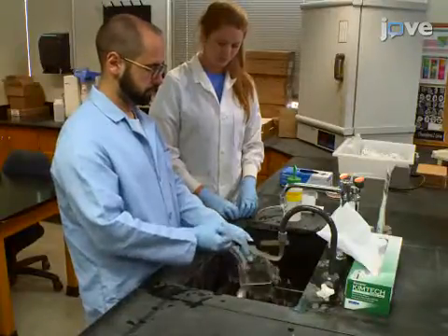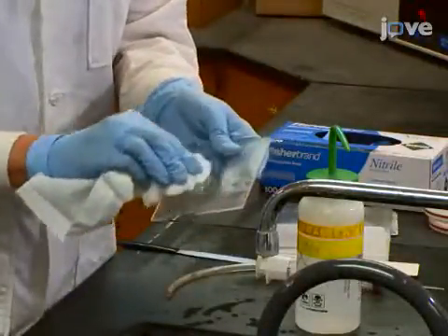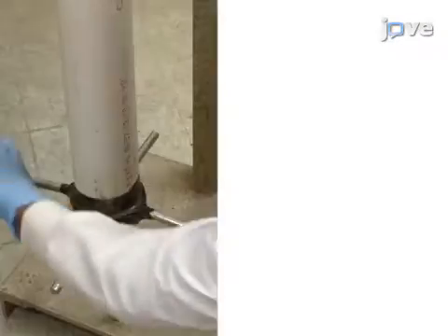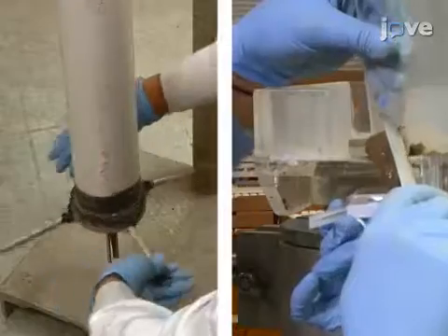Before proceeding, use deionized water to clean off the sampling tools and sampling collar and then sanitize these implements. After sealing the vessel, continue collecting all the required subsamples in the same manner.